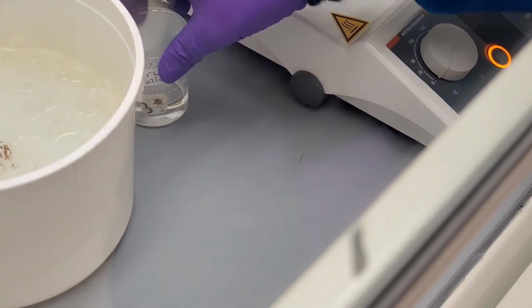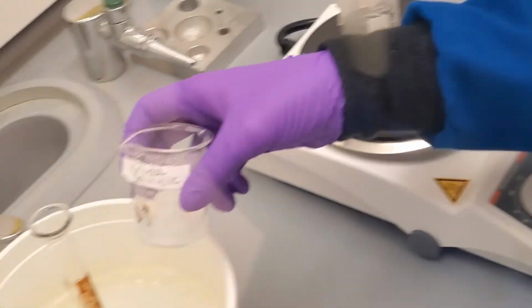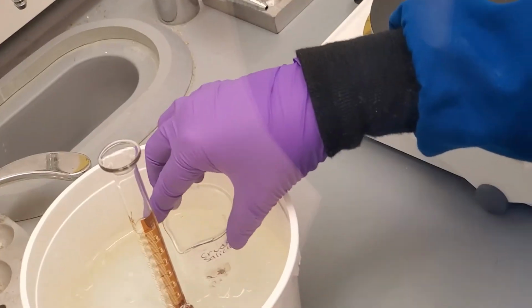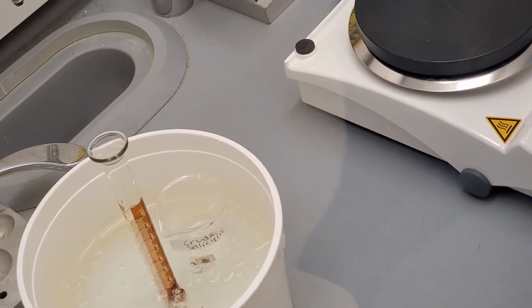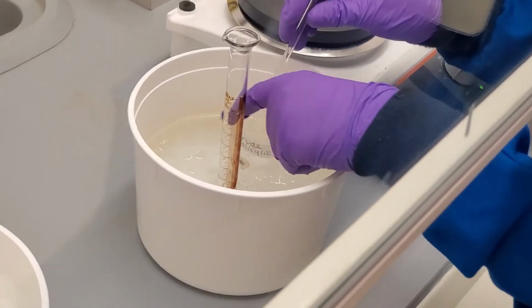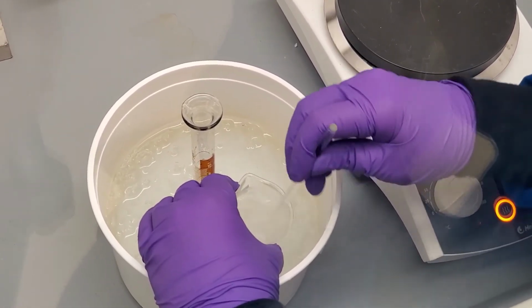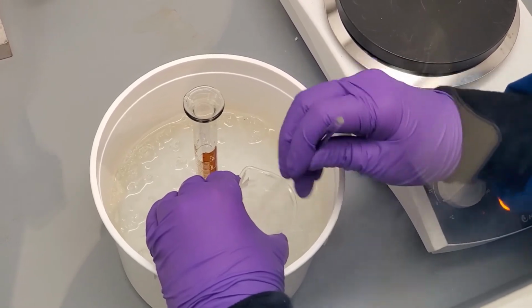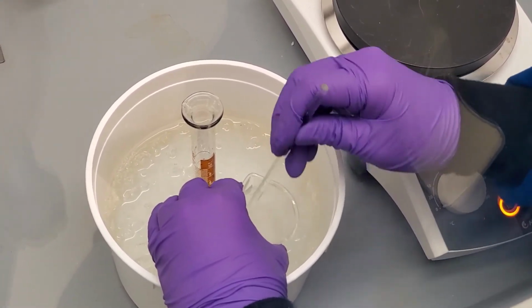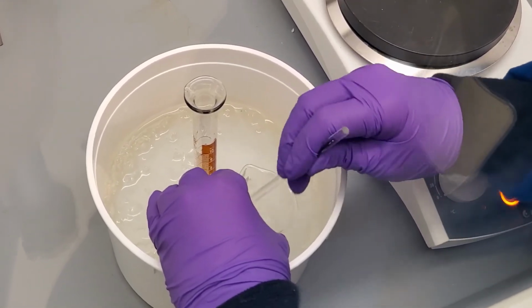As the beaker cools, precipitate starts to form. This time, the precipitate should only contain salicylic acid, as the impurities should still be soluble in water as the water cools. Once at room temperature, we place the beaker in the ice bath to further crystallize the salicylic acid. We also use a glass stir rod to scratch the glass. The disturbance causes more product crystallization.